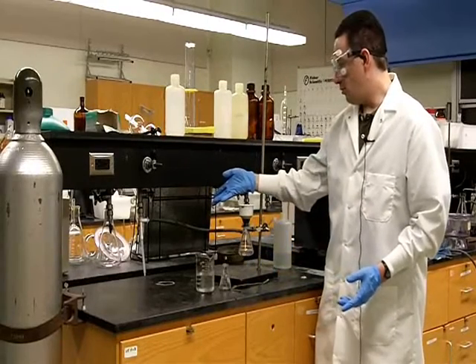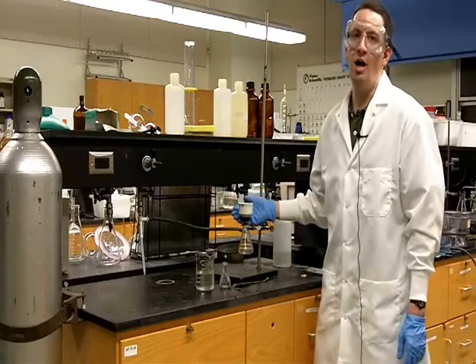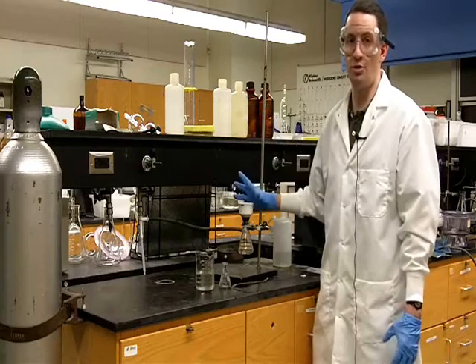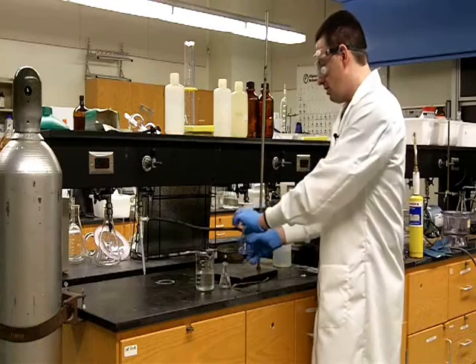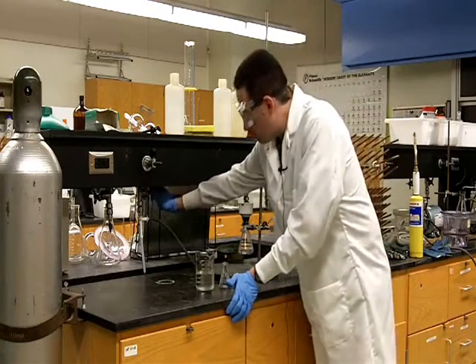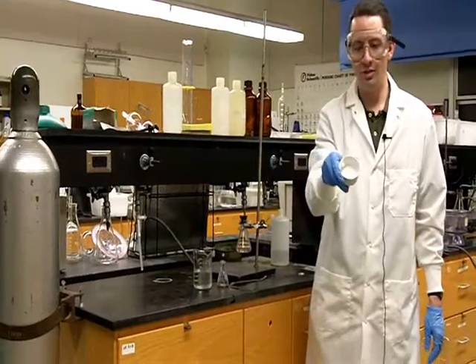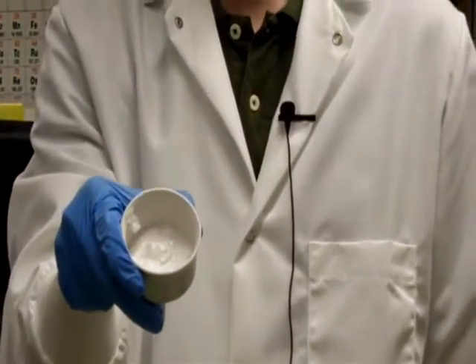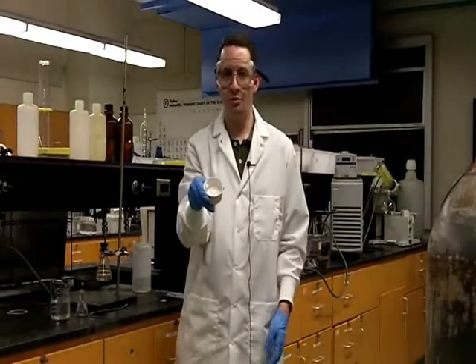Again, our aspirator, we would want it to be turned up higher, as high as possible, and then we'll let this sit on the aspirator with the vacuum pulling for about 5 minutes to help draw as much solvent away from our product as we can. Once we're done, we want to break the vacuum by disconnecting the tubing, turning off the aspirator, and now if we look inside our funnel, we can see we have our recrystallized benzoic acid. And once we've let this dry for now an extended period of time, we can go and take a melting point and confirm its purity.